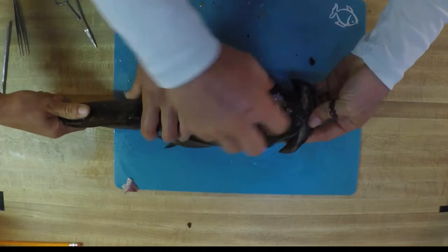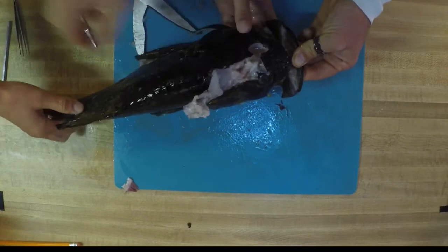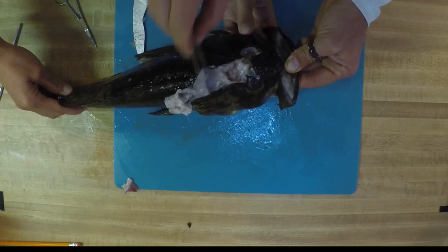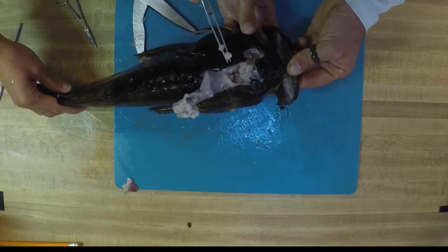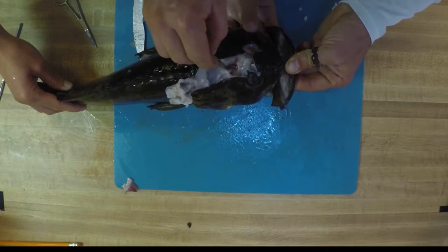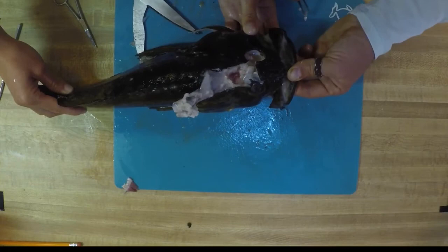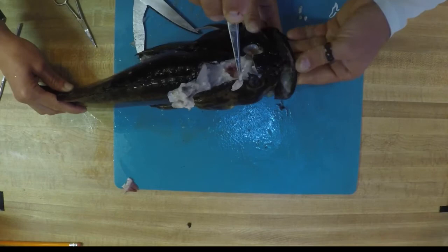So we've got these two parallel cuts. Now we're going to try and peel up the skull and see if we've made the correct cut to get into our brain cavity. We've got an opening into it. We'll start grabbing your tweezers and remove a little bit of that tissue that might be in the way. And what you should find is in this little area right behind the eyeballs. Part of this little bit — that's its brain. We have a small segment, just a little bit at a time coming out. It's very tricky to kind of pull an entire brain out, as you can see — it's coming out in little tiny pieces. These little pieces are also part of that brain. They're very hard to try and keep in one piece as you're doing a necropsy in this fashion. So we're going to keep tinkering around and looking farther and farther into our brain cavity — we're looking for something very specific.